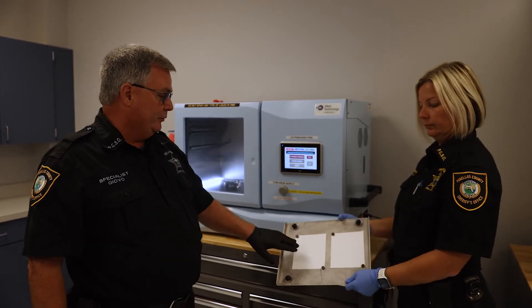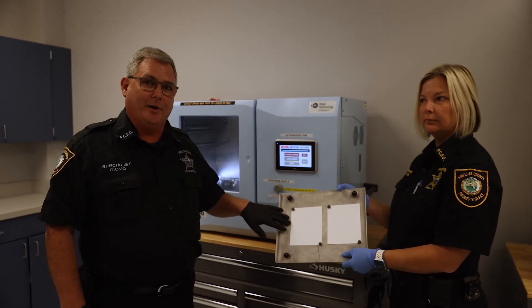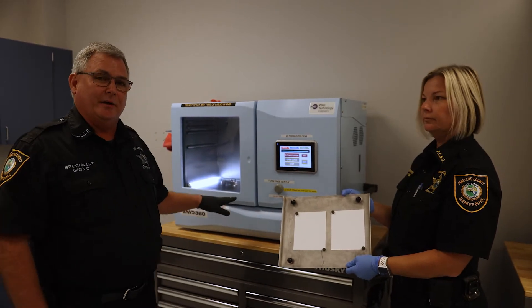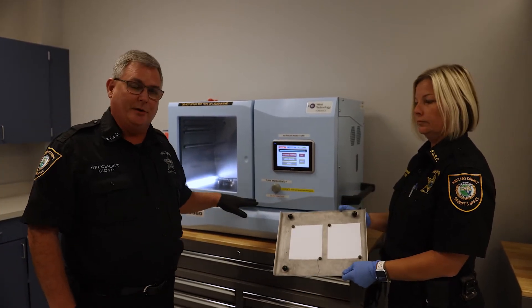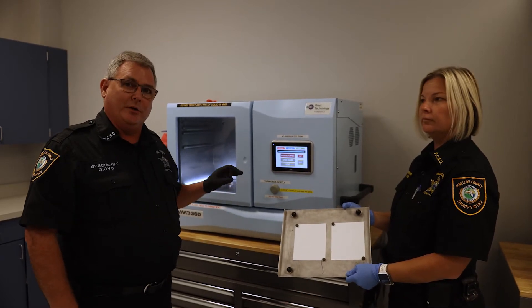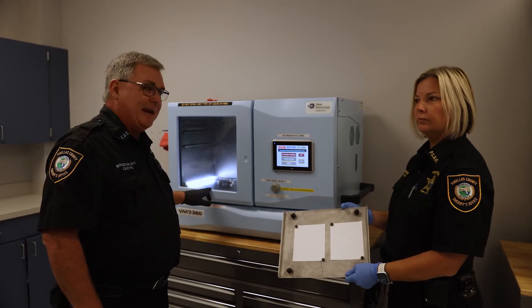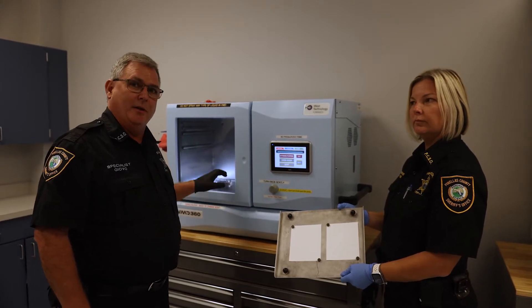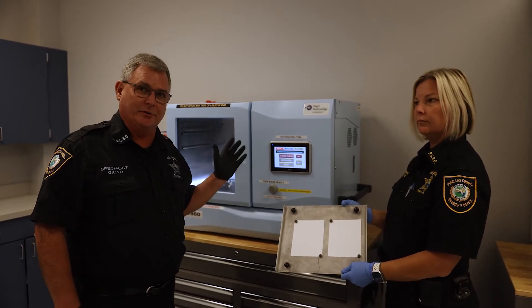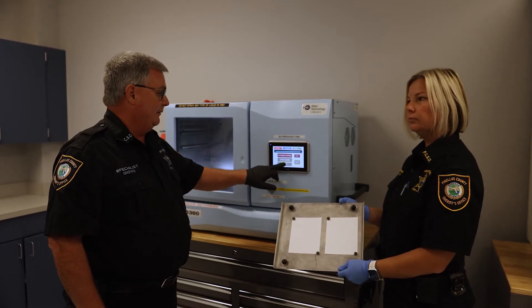Today we're going to use two white cards that we have deposited fingerprints onto. With the VMD itself, we're going to use precious metals — it could be gold, zinc, aluminum, or copper. Those metals are going to be heated and then vaporized. Once they vaporize, they're going to attach themselves to the fingerprint residue that's left behind. So at this point, I'm going to put it inside the VMD.